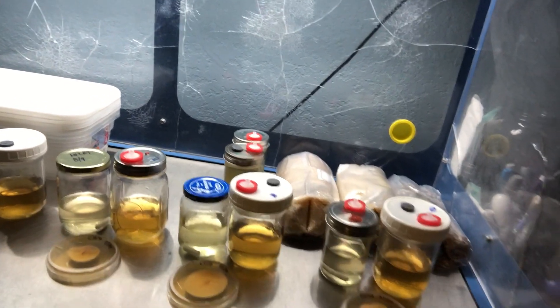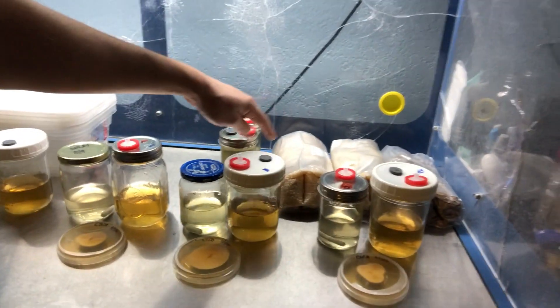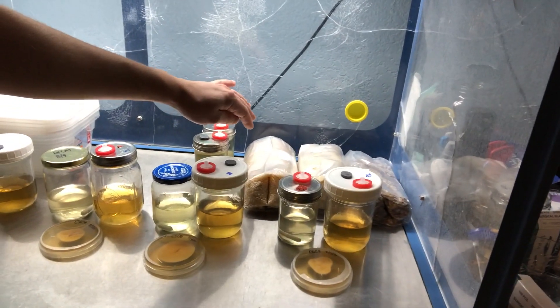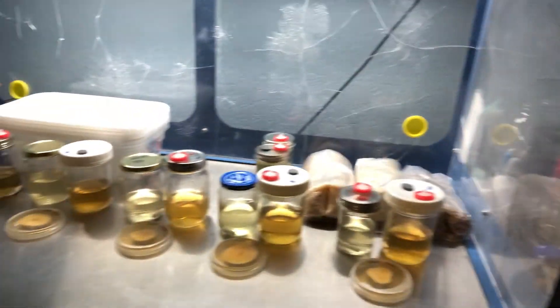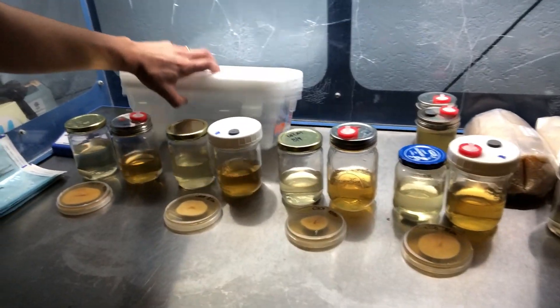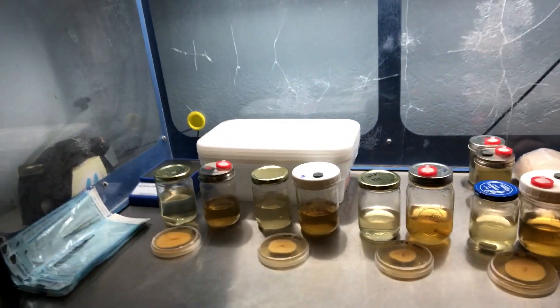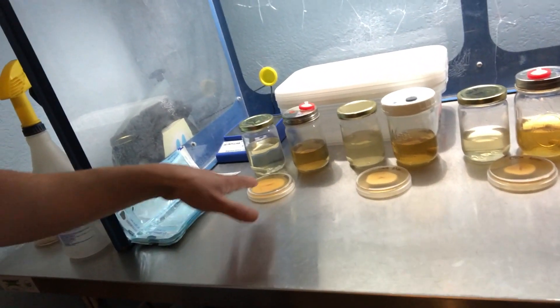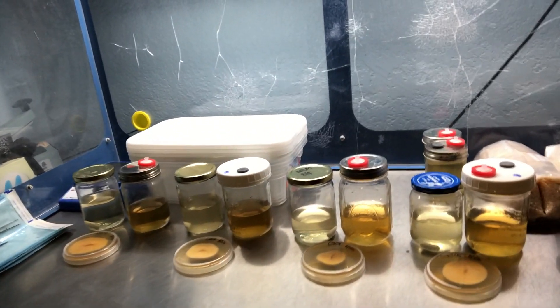I've got two different types of grain right now. I'm gonna be using a whole white short rice, and then also some oats. I'm gonna be inoculating those into these six-inch shoe box totes that I got at Walmart, so I'm gonna do my test trials on those and then inoculate these cultures into the various different types of broth.